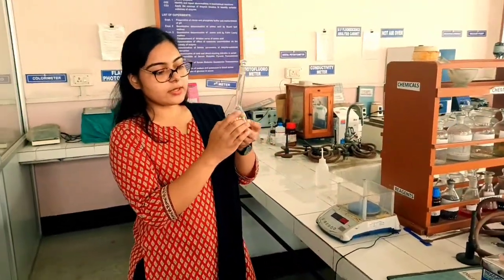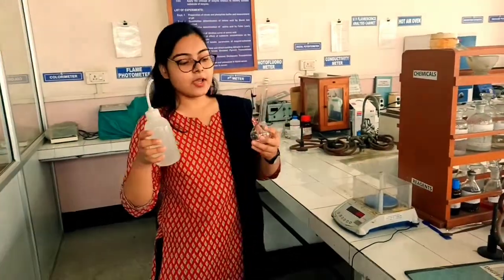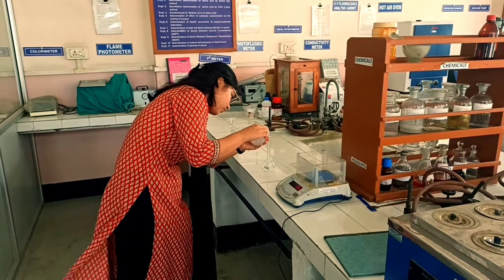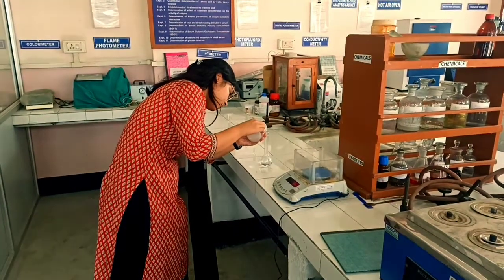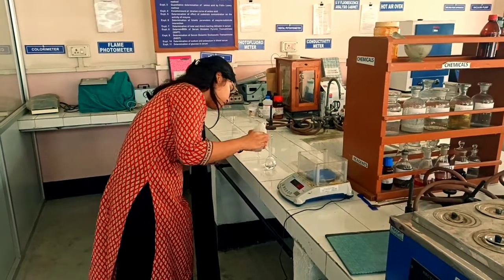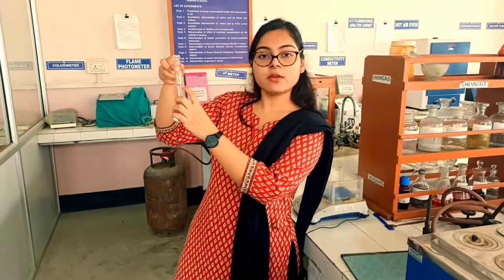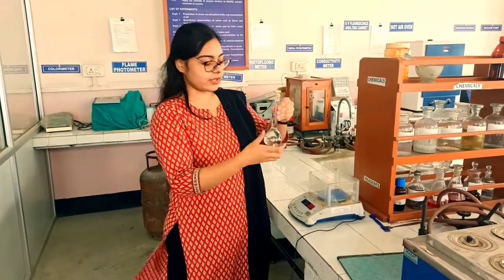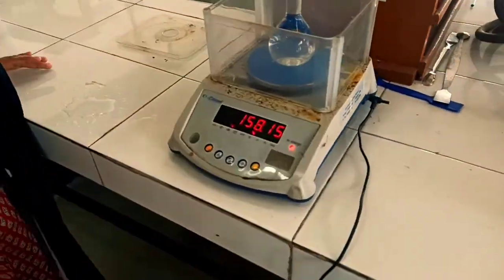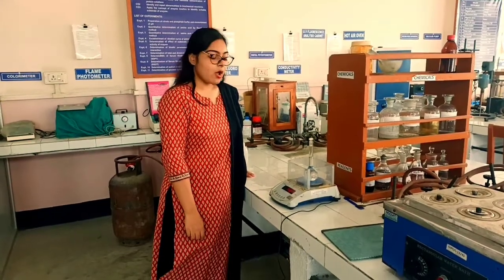Then we have to fill the flask till this mark. It is a 100 ml flask, so we have to fill it with distilled water till the 100 ml mark. Now again we have to take the weight of this flask. You can see that the weight of the flask comes out to be 158.15 grams, which is more than the empty weight of the flask.